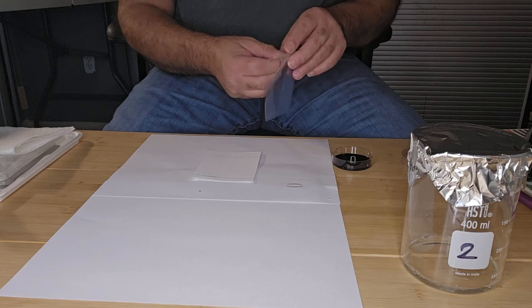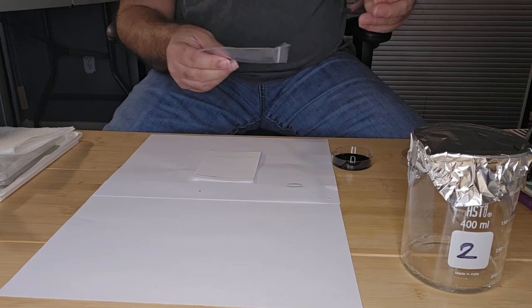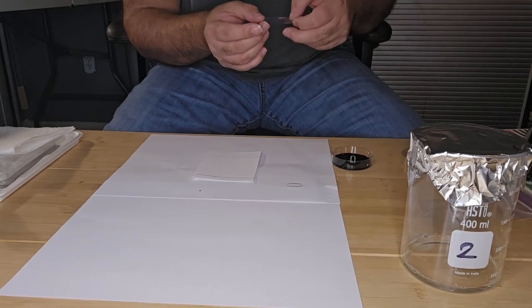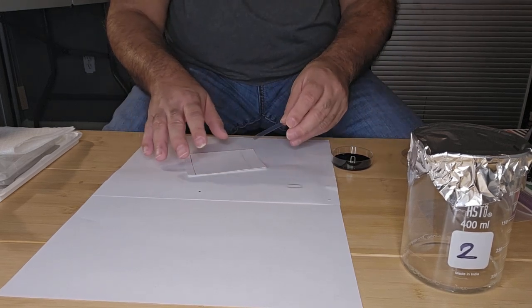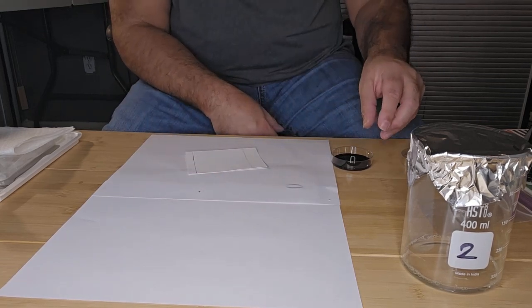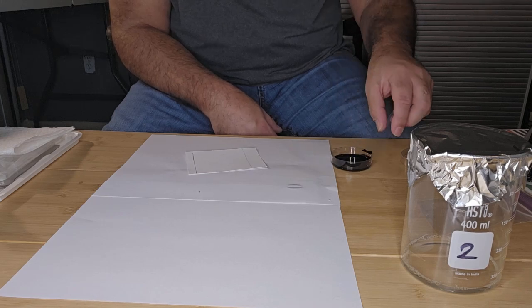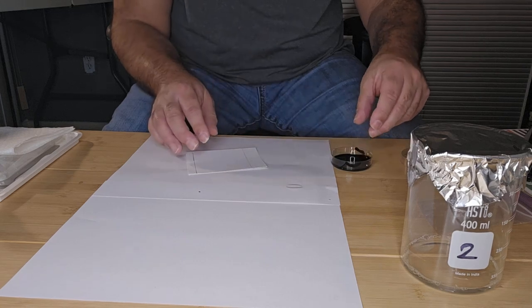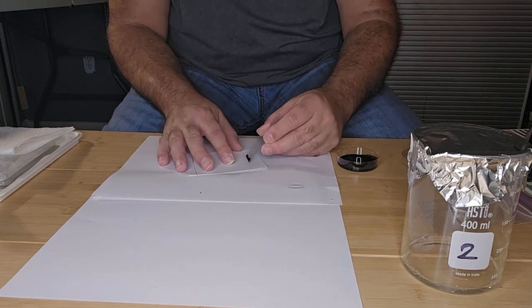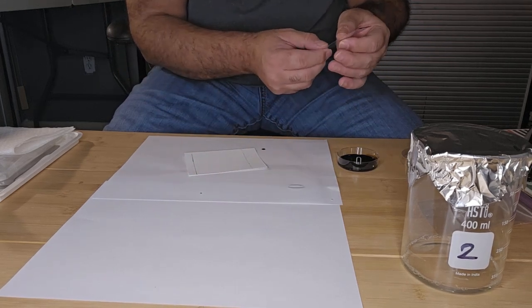I also have a plastic applicator. I'm just going to turn this around so it's easy for me to apply. I'm going to dip this into the plant pigment very quickly, and then apply it very quickly onto my paper, putting it against the line, like so. Oh, it's not dripping. Where is it not dripping? Okay.